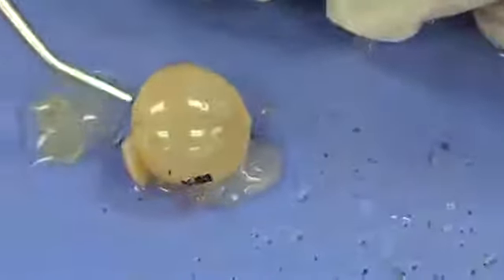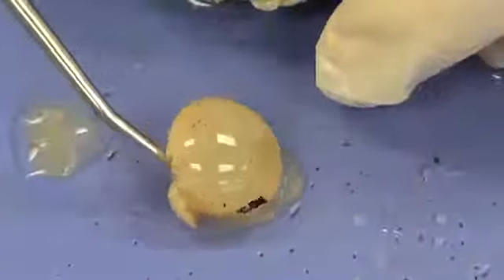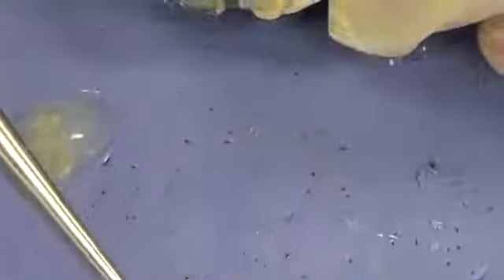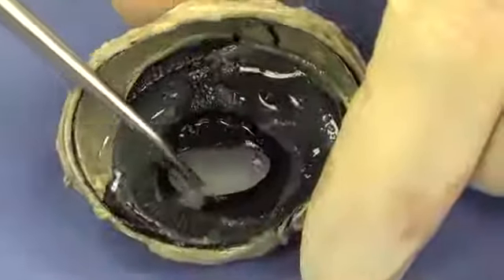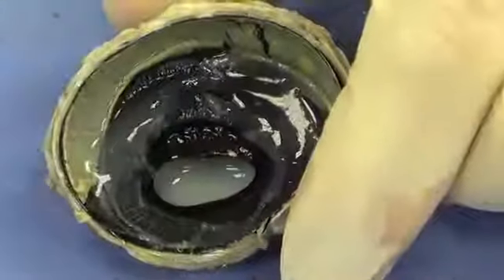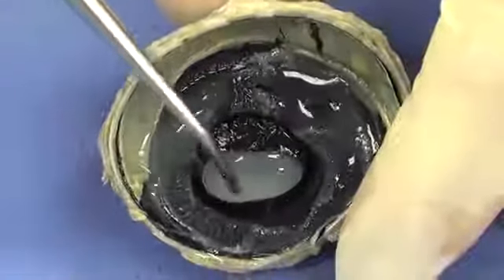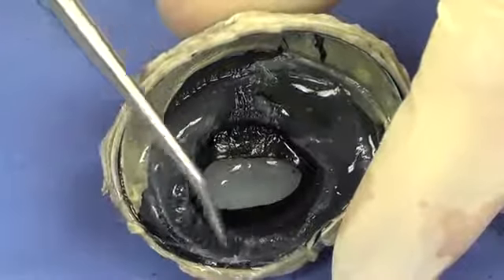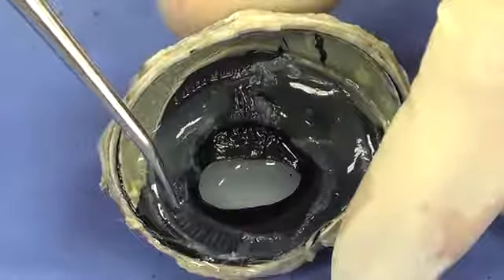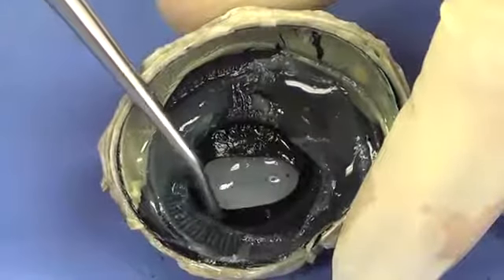If we were to cut the lens, it would look essentially the same. Might look layered inside, a little bit like an onion. So I'm going to move that out of the way. And we're going to take a look at some of these additional structures in here. Just going to move some of that out of the way. And medial to the striated substance was the ciliary body, is going to be a more smoother looking black structure.